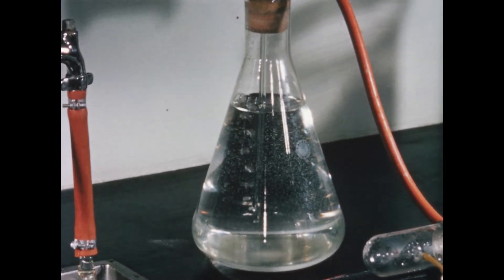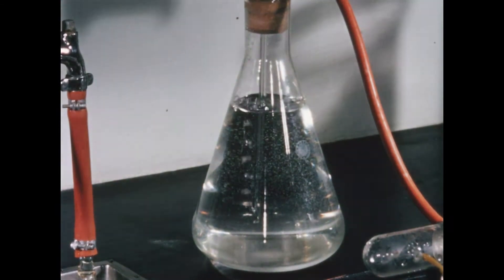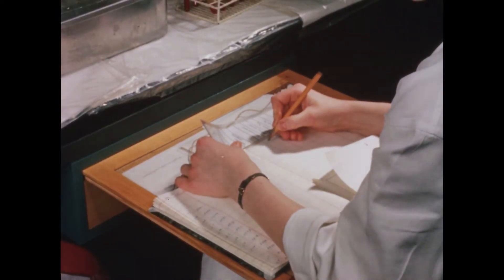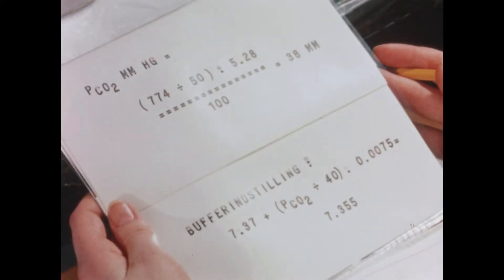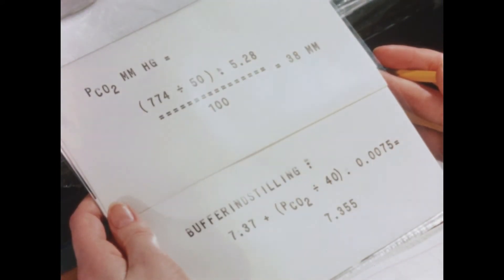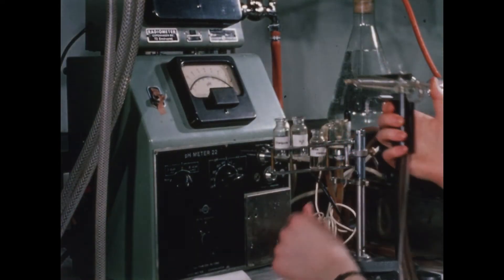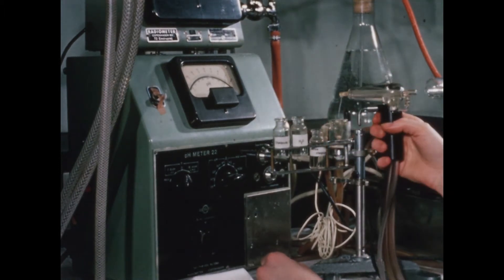The final measurement is done by a glass electrode and a pH meter. First, the pH meter is adjusted by measuring while the electrode is filled with a buffer of a known pH. The electrode is rinsed with water and again filled with buffer for new adjustment, suction being produced by pressing a finger against a hole at the back of the electrode.